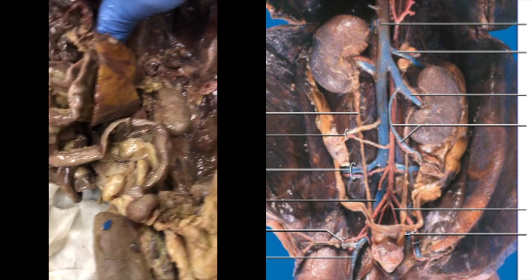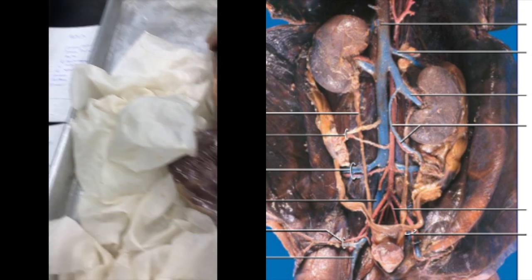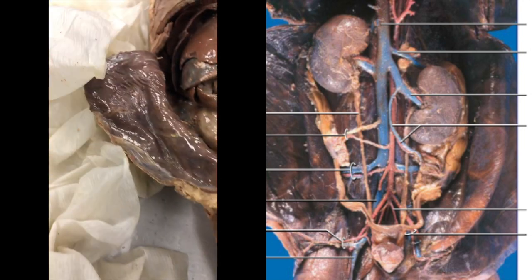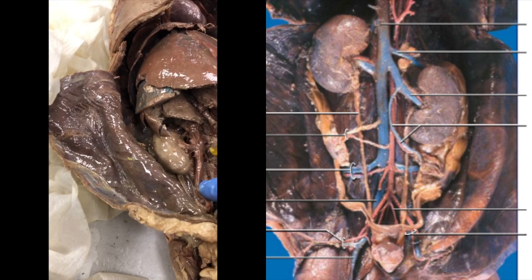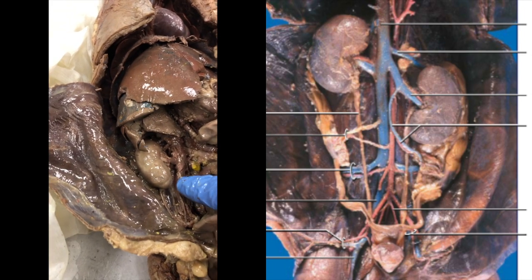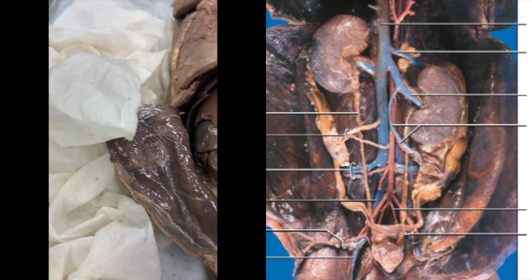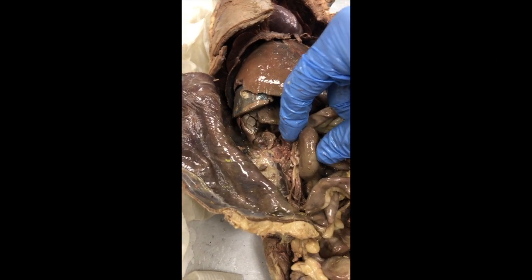So I'm going to try my level best to see if I can liberate some of these other structures here. There's some things that you can see right off the bat. I mean, we have a kidney right there. We have the inferior vena cava right there, and we've got the artery and the vein supplying it. It looks like a lot of the dye leaked out on this one. So I'm going to move over to the other mink.